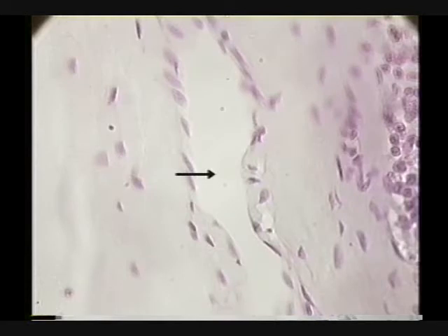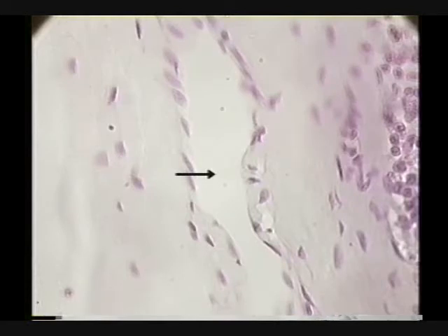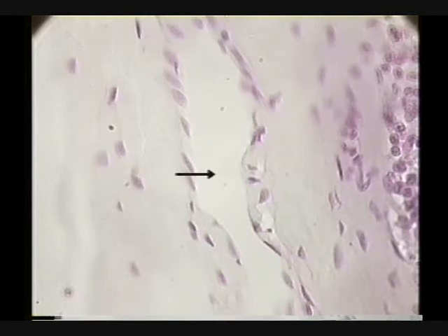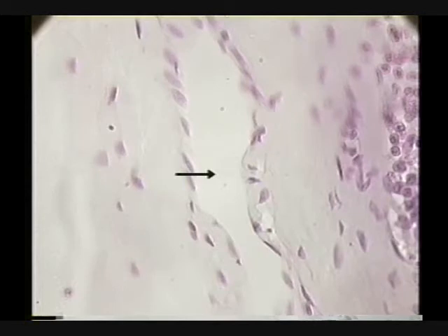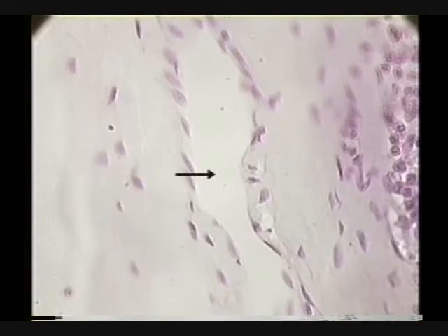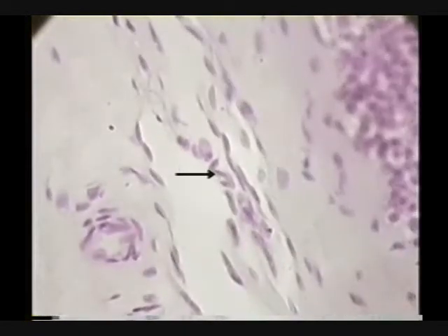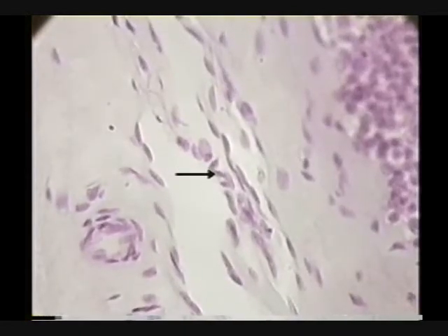Like a kidney-shaped structure with a little indentation - hilum occurs on many things. It occurs on kidneys, lungs, and lymph nodes. It's a description of that depression. This looks like a lymphatic vessel in the capsule - you can see the simple squamous lining, though I don't think I can say that's part of a valve.